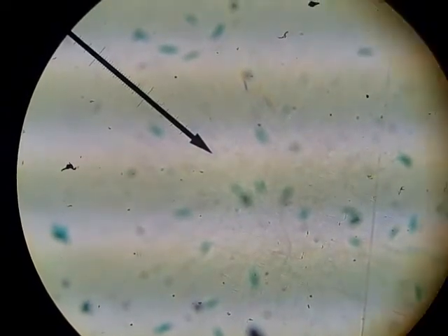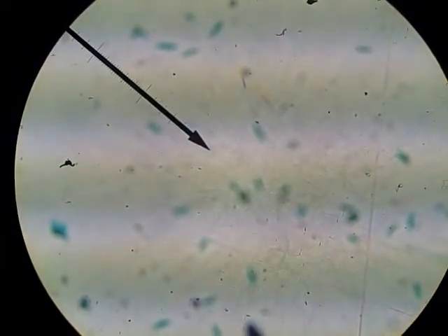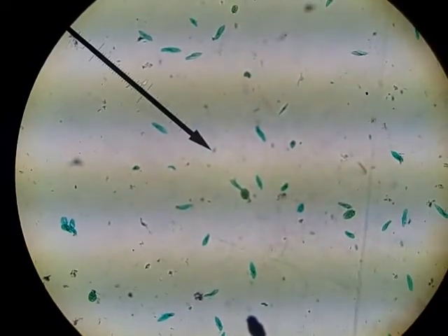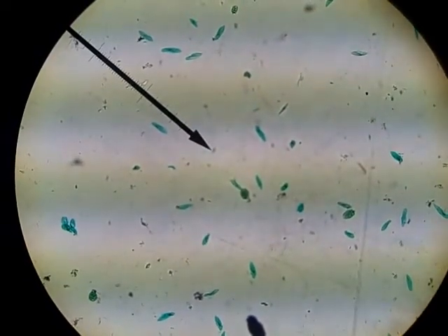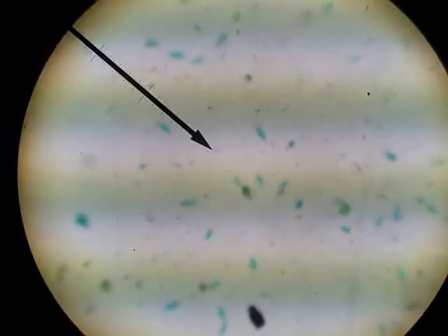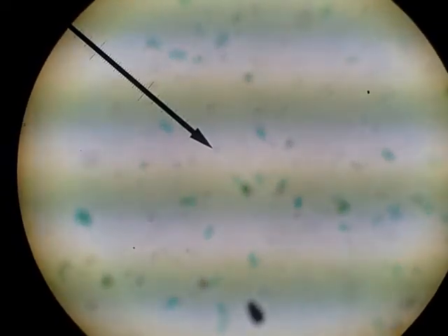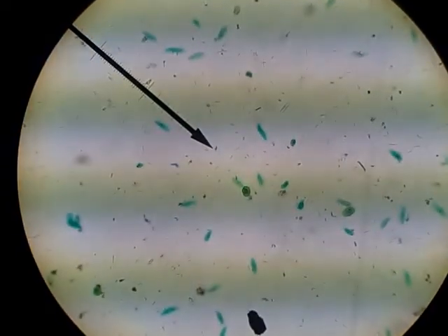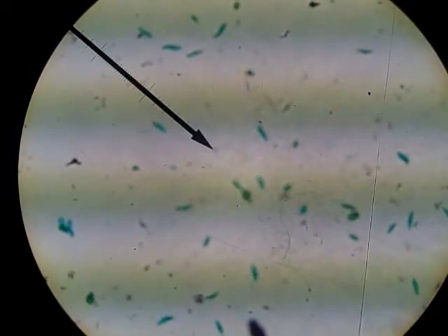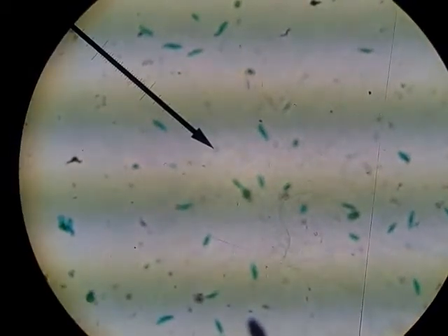To bring this in focus, we're going to roll down our coarse adjustment. As you can see, the image is becoming a little sharper. Don't be afraid to go further. And as you can see, it's getting blurrier, so you may want to roll it back up until it looks the best to you as possible.